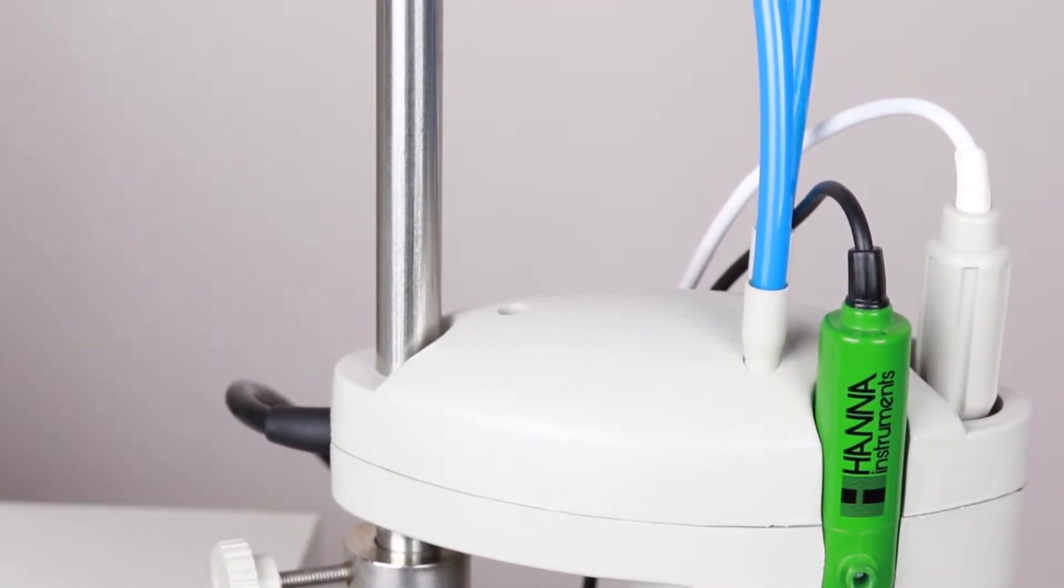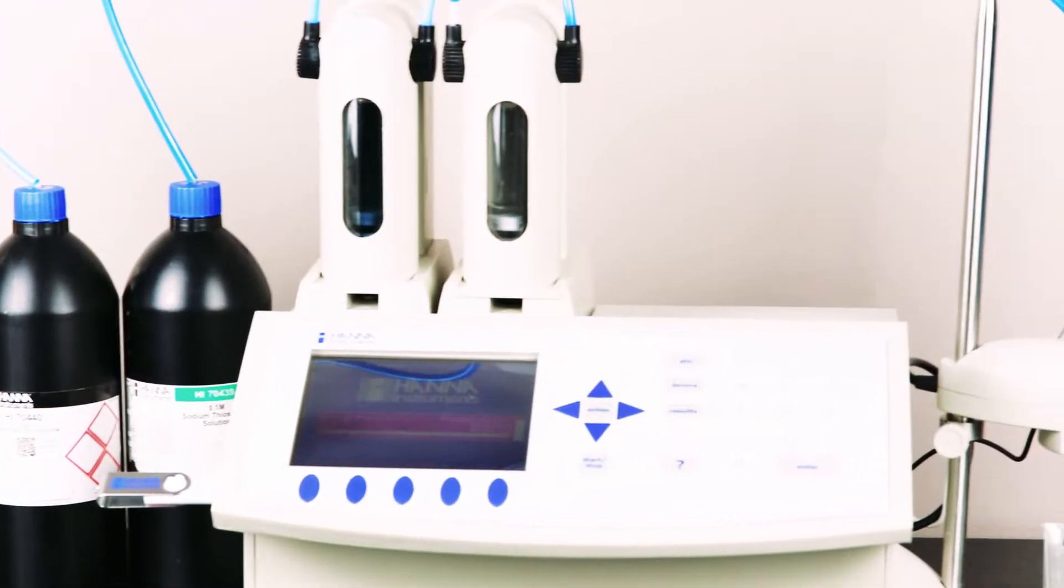The HI902 can support up to two burettes at once. Additional burettes can be exchanged easily.